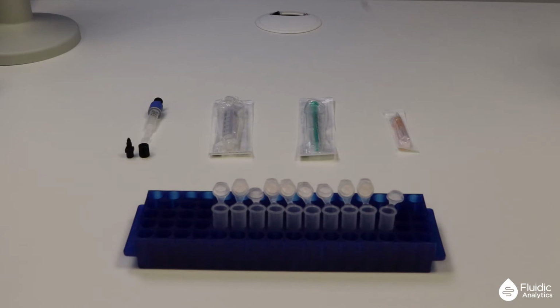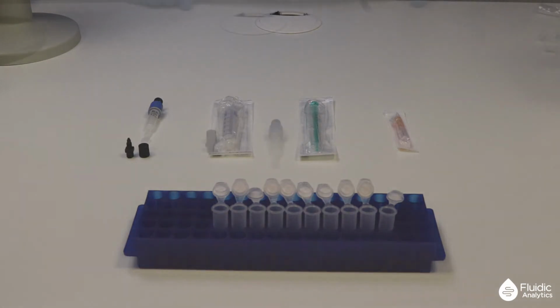We routinely use PBS, but if your protein requires the use of a different buffer, then use that instead. At this point, free amines are no longer a problem in the buffer, so can be included if required. Before starting, open your microtubes and place them in a rack.